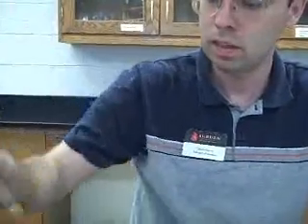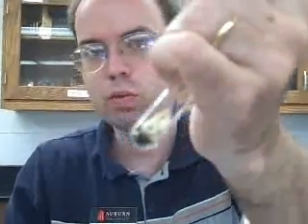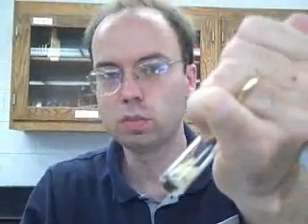The next carbohydrate test was the Gram's iodine test for starch. All we had to do was add some Gram's iodine to the tube. Gram's iodine is brown or golden yellow in color, so a negative test is golden yellow. A positive test is black or dark purple. For example, with potato chips, you can see it's turning black when we add the iodine, so starch is present in the potato chips.